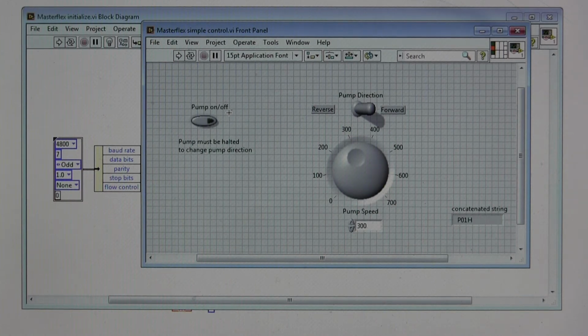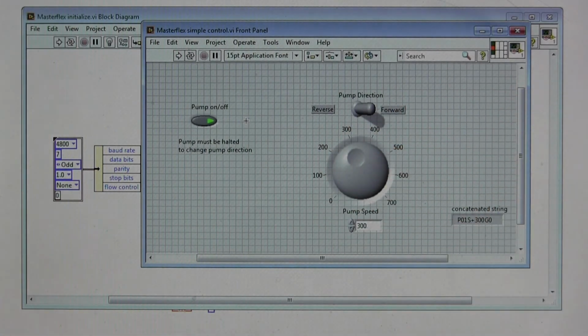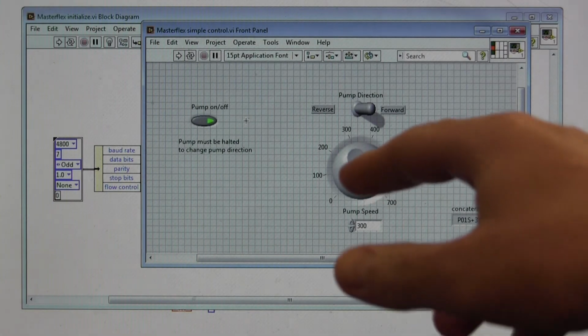Now you'll notice something interesting here. This program, it really only runs for a brief moment. Notice it says running, and then everything turns off and it quits running. When I turn it on, I press run. This program is not running anymore. The pump is running, but the program is not.